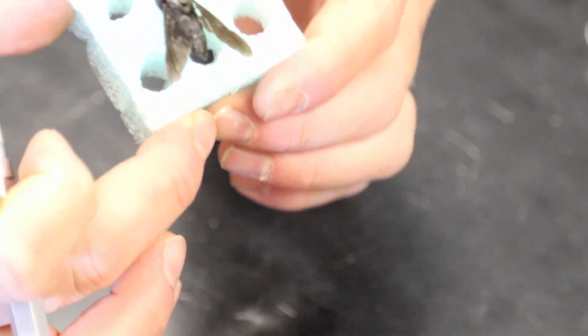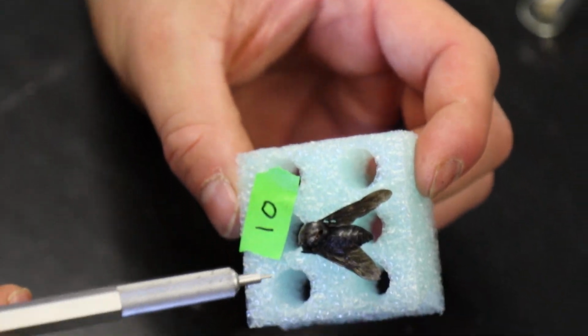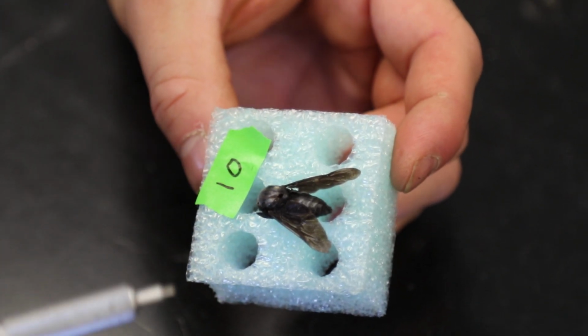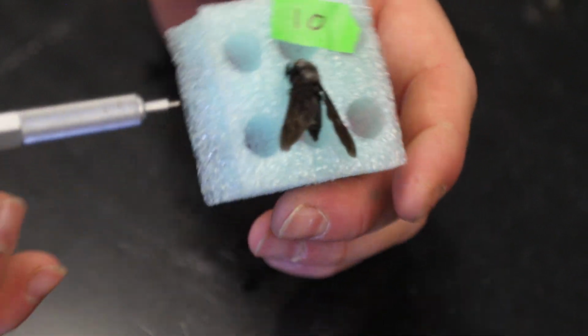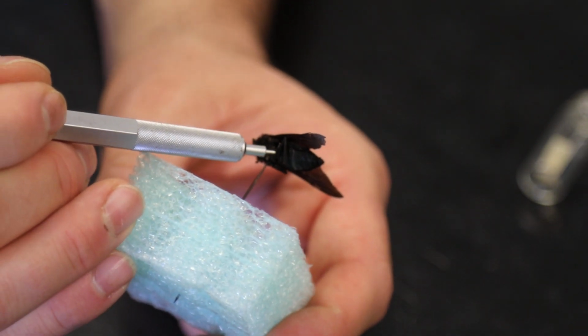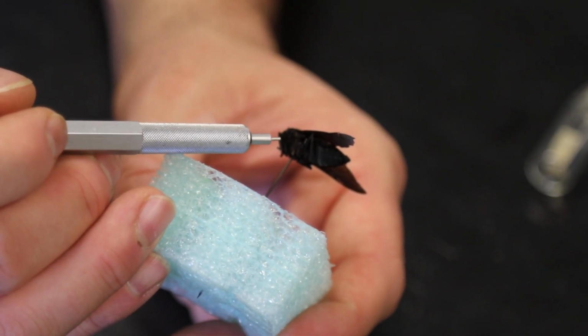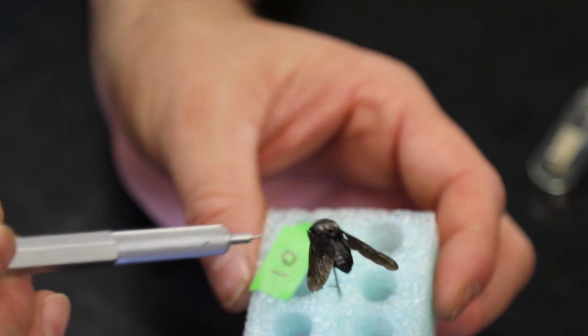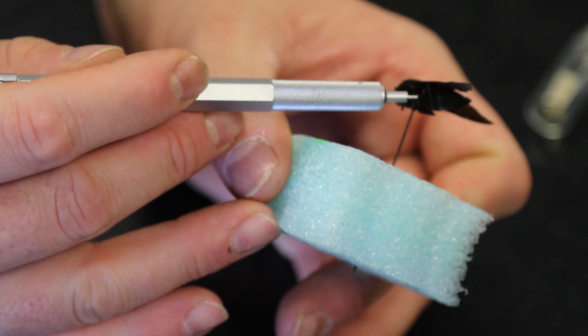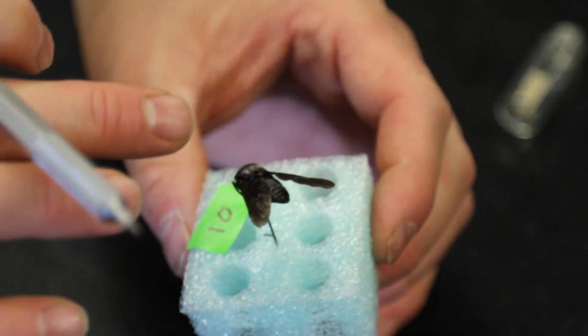So we're going to come back to Diptera here. Here's a good example of a dipteran. This is a black horsefly. They have 2 wings. Now, insects have 4 wings. This one does have 4 wings. The second set of wings are reduced halteres down in here. It's really hard for you to see them, but they're little pressure pads. So if you see an insect with 2 major wings and then a set that's reduced into little pressure pads, that is a dipteran.